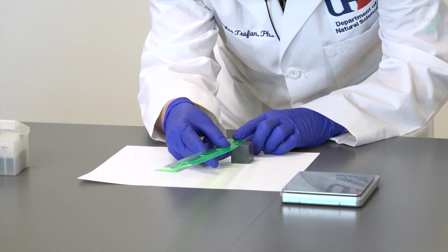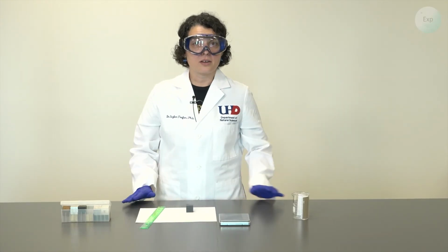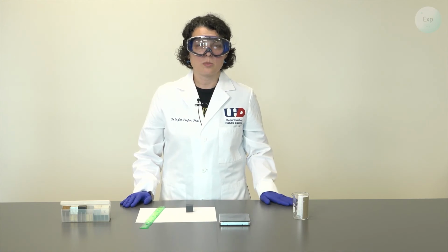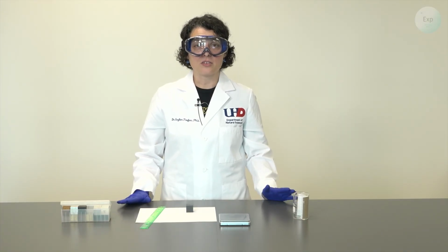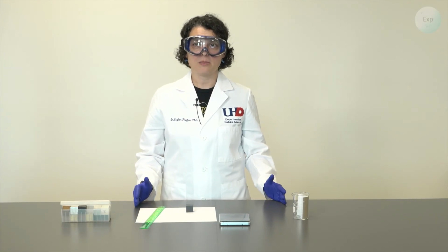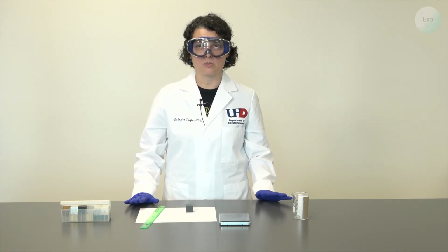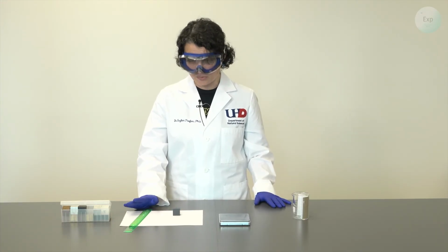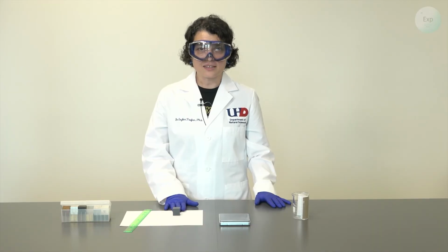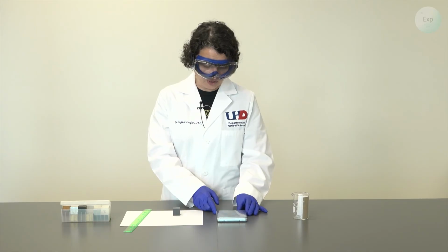It is 2.51 centimeters. The product of these 3 values that we measured, 2.51 times 2.50 times 2.51, is going to give us a number. And the product of our units, centimeter by centimeter by centimeter, is going to give us the cubic centimeter that is the volume unit. Now that we have our volume determined by measurement of the 3 lengths, width, and height, we are ready to determine the mass of our object.